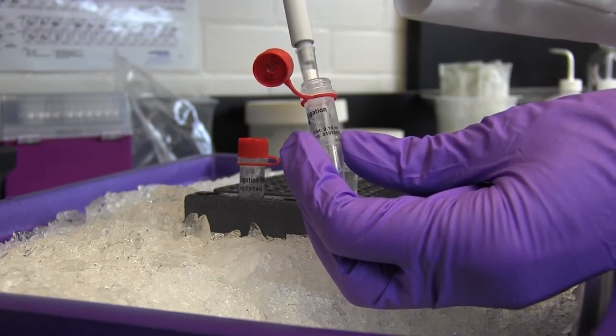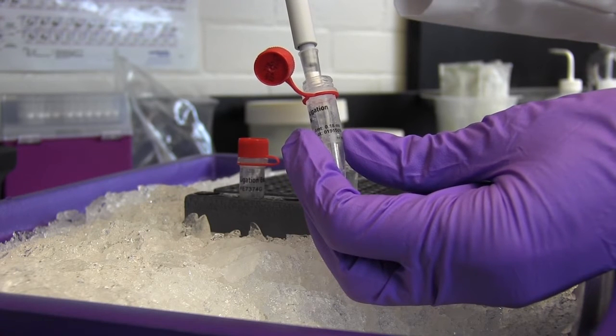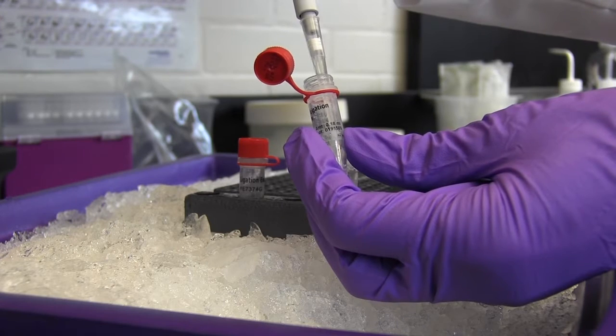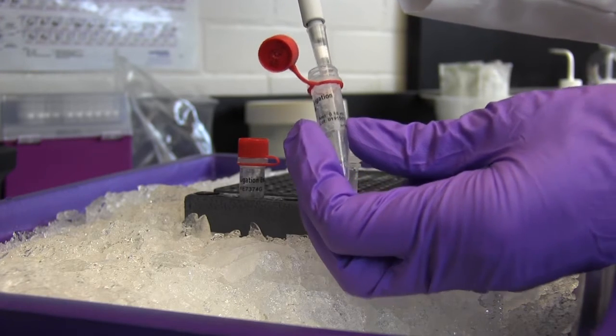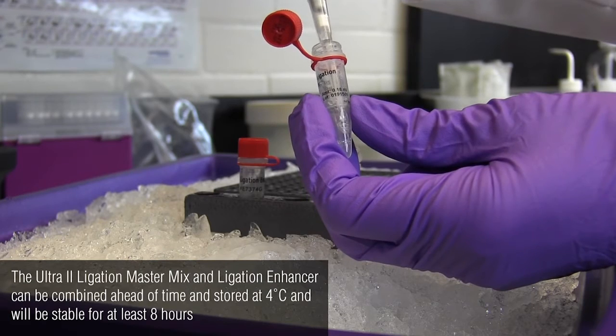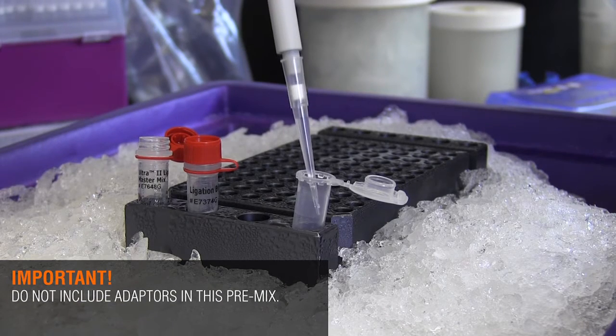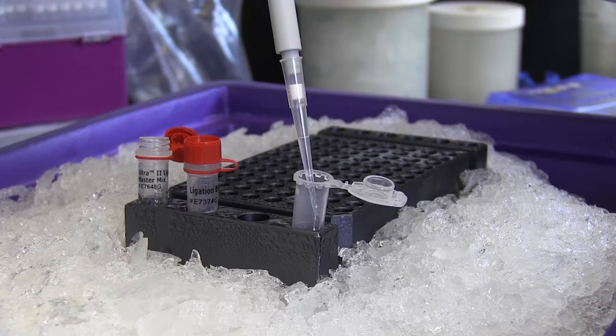Note that the Ultra 2 ligation master mix is very viscous, so it is important to pipette slowly to ensure you are getting the desired volume. The Ultra 2 ligation master mix and ligation enhancer can be combined ahead of time and stored at 4 degrees Celsius and will be stable for at least 8 hours.